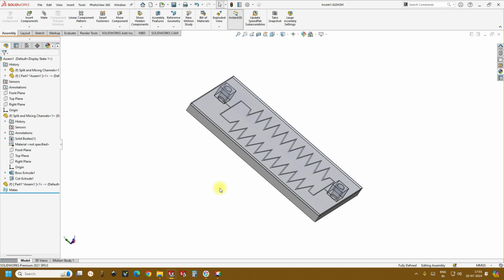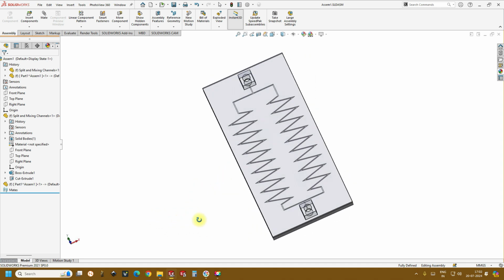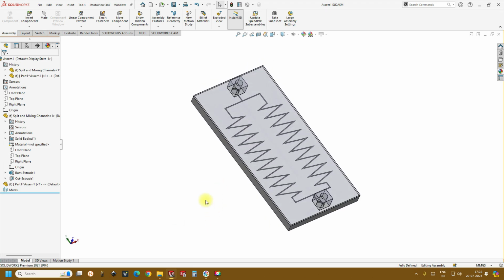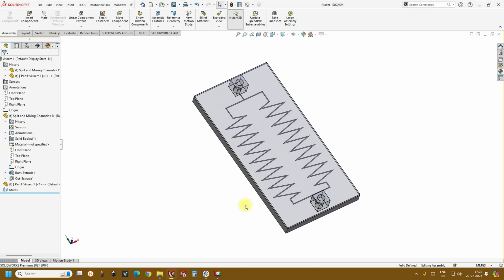So today we'll be doing the double split and zigzag microfluidic channels, and this is how the final setup looks like. Okay, going forward. So here what we do is the same way as our previous discussions.